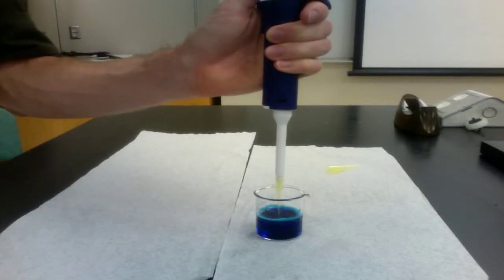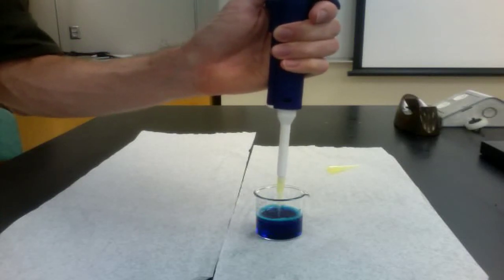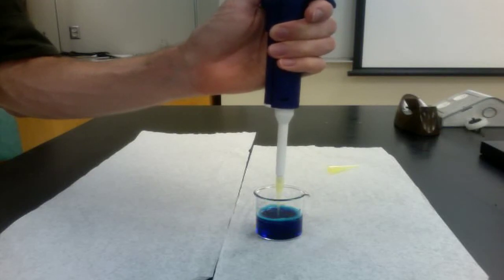To fill the micropipette, push the plunger down to the point of first resistance, immerse the tip in solution, and release the plunger slowly.